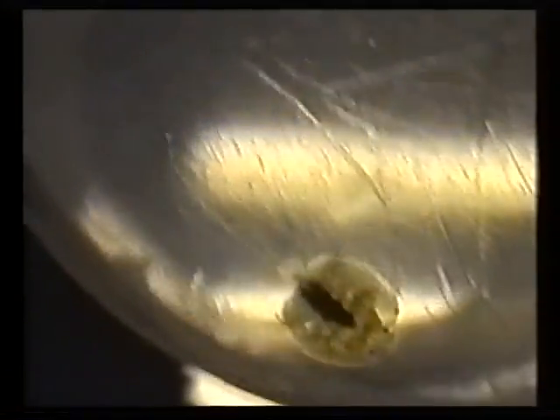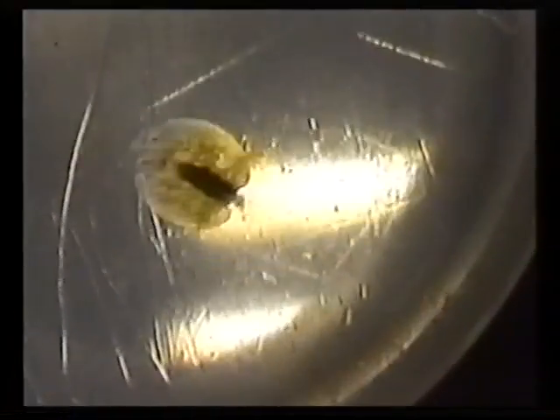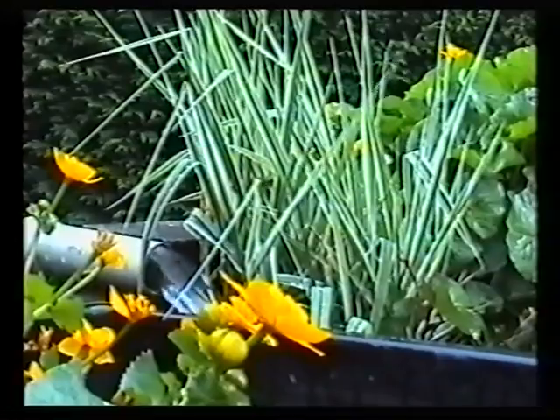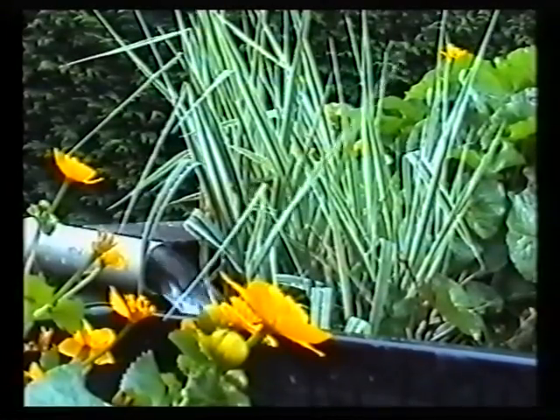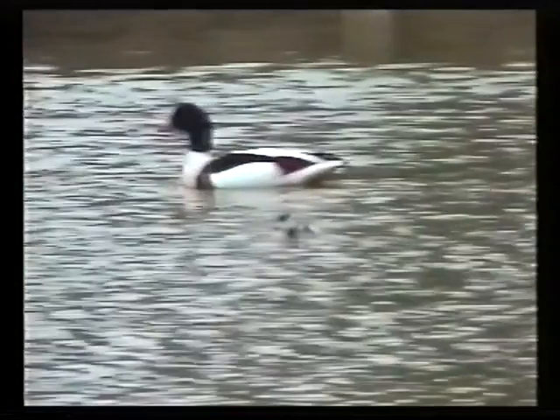From the second copepodid stage, the parasite develops paired swimming legs on all 4 thoracic segments which enable it to efficiently move within the body of water it inhabits. Amphibians and plant life may also assist in the transmission process of the parasite. It is also possible for the parasite to be moved short distances on the plumage of birds.